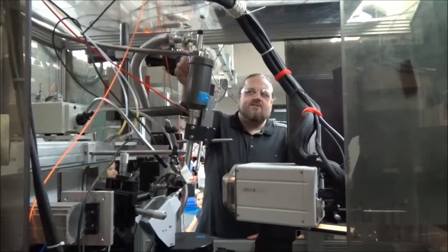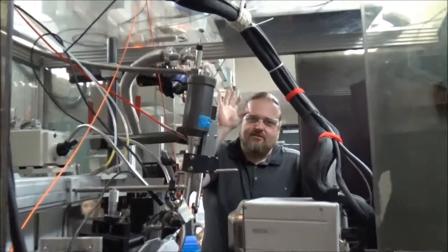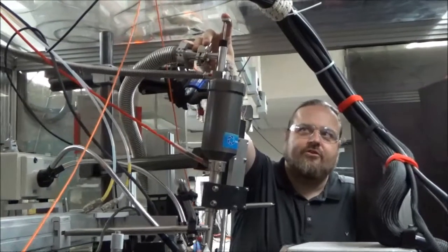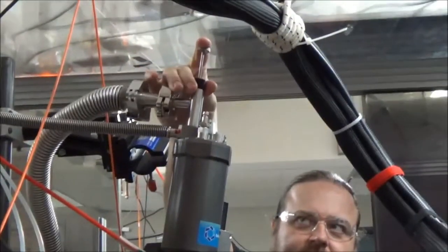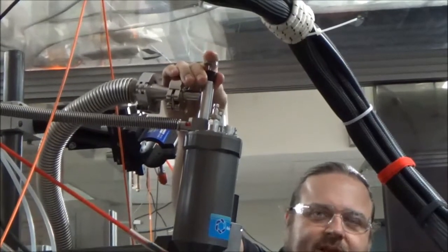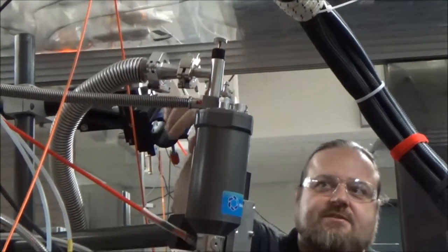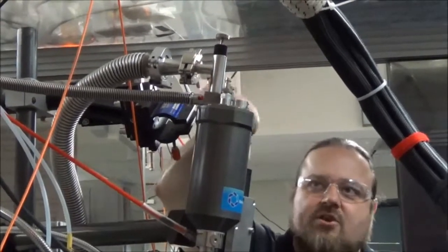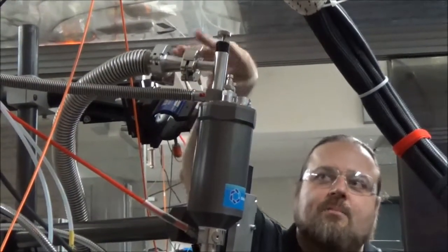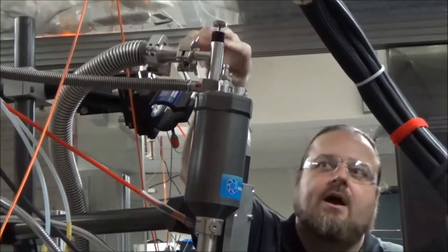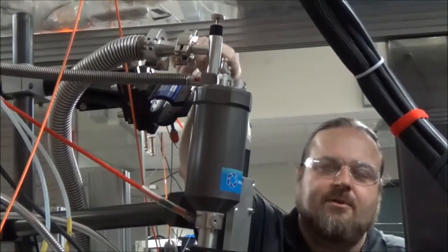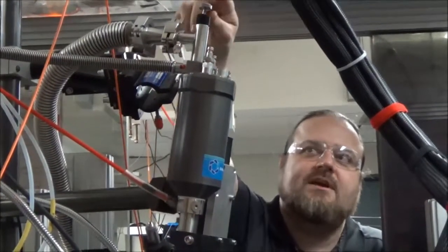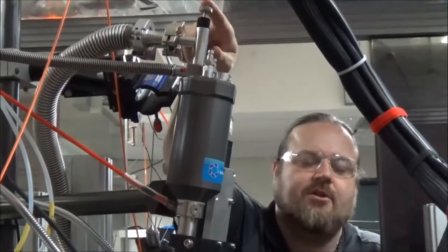Okay. So we know that this is all nice and clean and dry and under vacuum right now. And remember we have this plug. What we're going to do is we're just going to push down on this plunger and put this plug in place. Okay. So the system now is nice and closed and sealed. Now it's still really easy to take the plug in and out because the whole thing is under vacuum. But if we break this vacuum, what it's going to do is it'll be ambient pressure up here and that's actually going to hold the plug in place and make it a lot easier to take out the plunger.